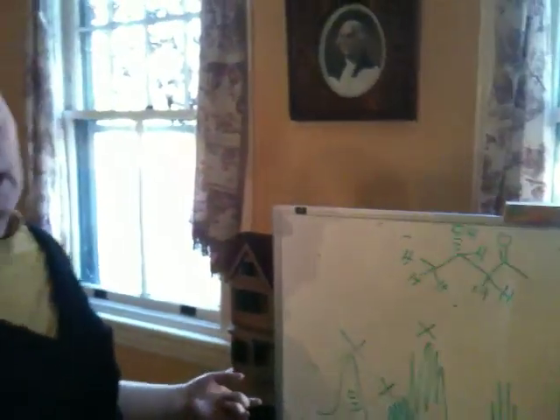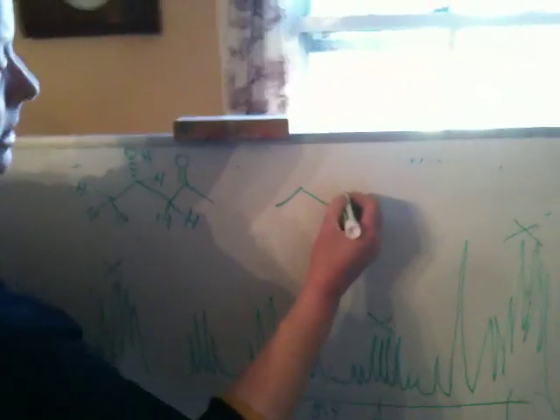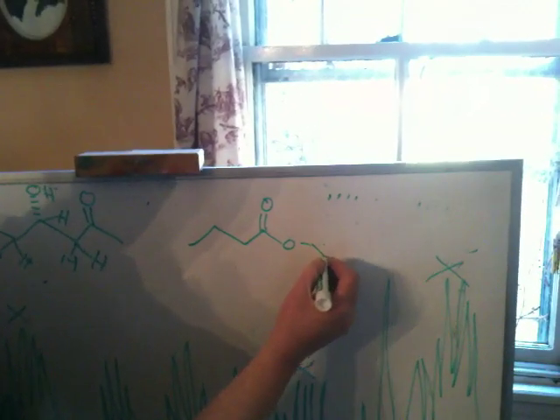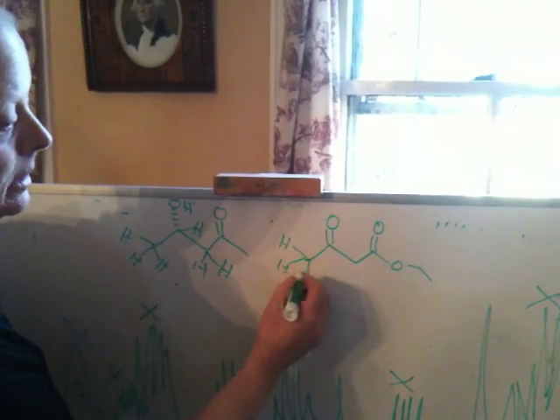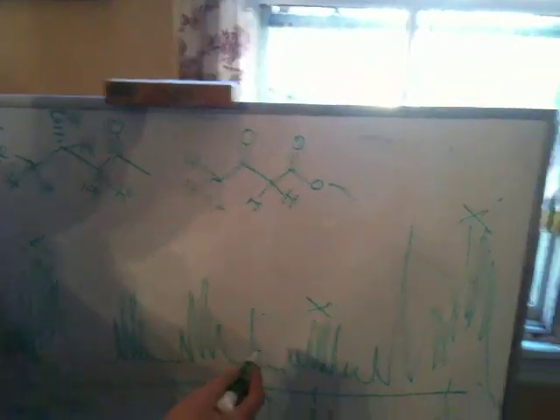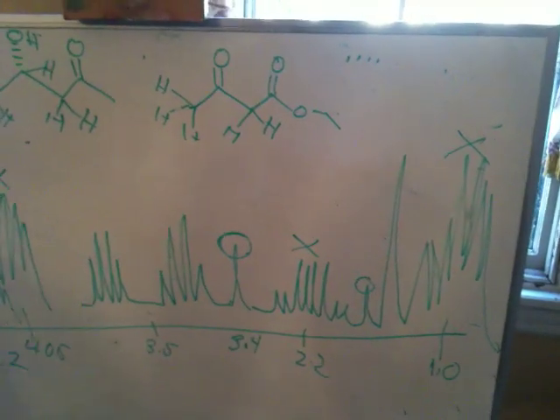What is the rest of this mess? As I indicated, you need to look at the starting material, and I want you to spend most of your time on the NMR, not on the IR. The IR is interesting, but it's very simple. What kind of NMR would this give? You have to look at these hydrogens. You can actually look this up in the literature and get its spectrum. You don't have to just guess at where the peaks were, but one of the things that's important is you all have singlets that are in a 3-to-2 ratio. That's this and this, and again, I may not have them perfectly placed.